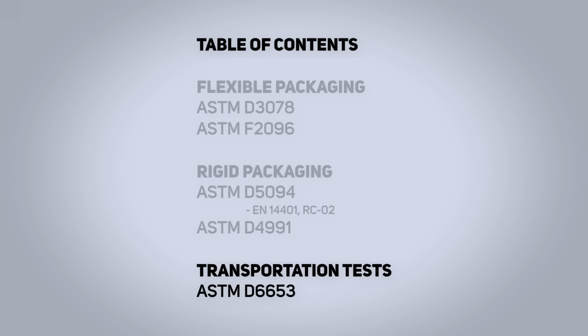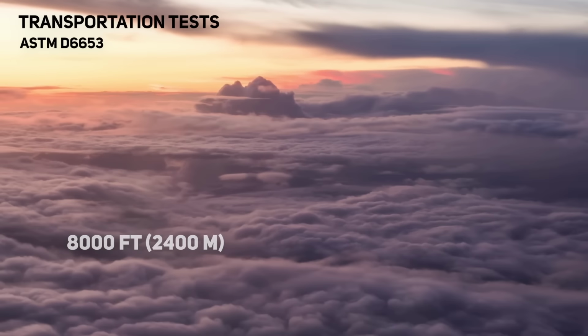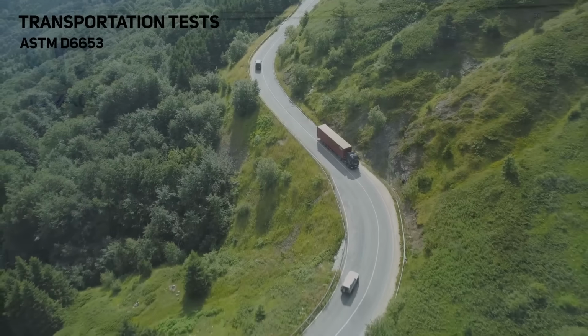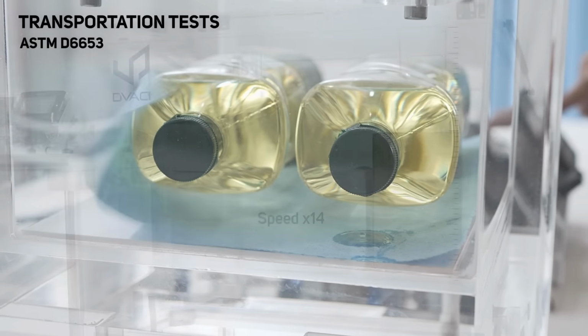ASTM D6653 is useful for transportation tests involving altitude variations, simulating conditions of air or ground transport in elevated areas by matching atmospheric pressure conditions throughout the journey by adjusting the vacuum levels within the chamber.